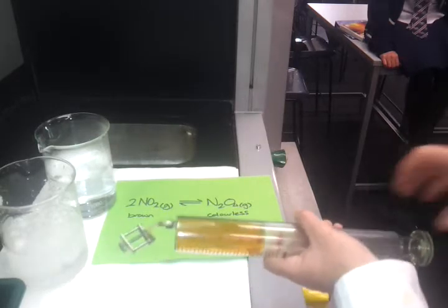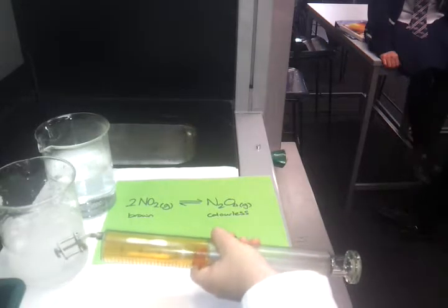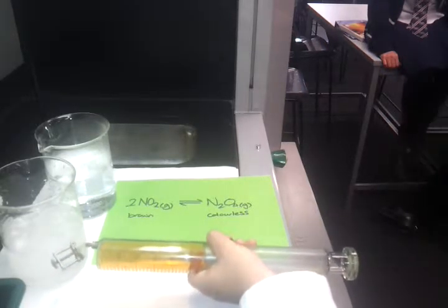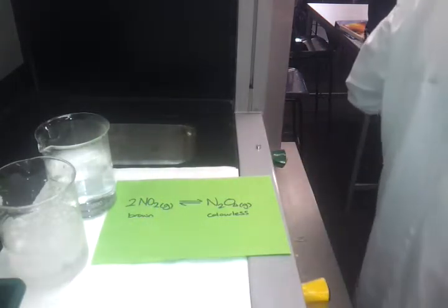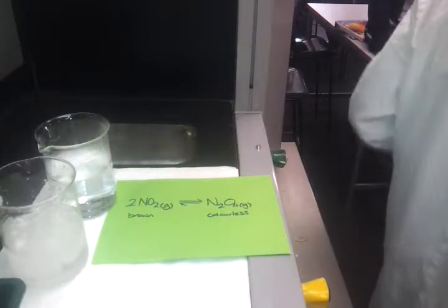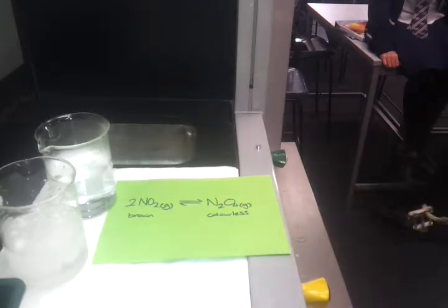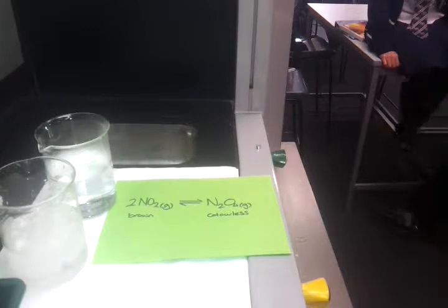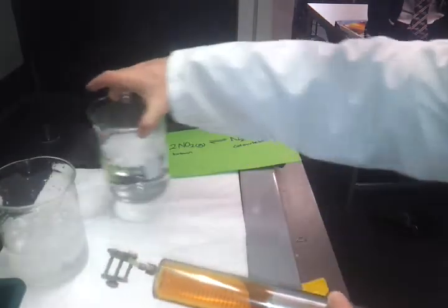If I decrease the pressure, so pull back on the syringe, it goes lighter, I hold it out there, the colour slightly darkens. Again, I've done that in front of the video, now I'll show you that here. Goes a little bit lighter, now it's starting to go darker. That's not particularly easy to see, is it? Okay, well, one of these reactions is exothermic and one is endothermic. If the reaction one way is exothermic, the other one must be endothermic. So I'm going to use hot water and cold water to show changes to the equilibrium as well.